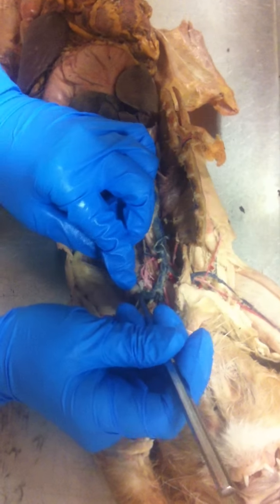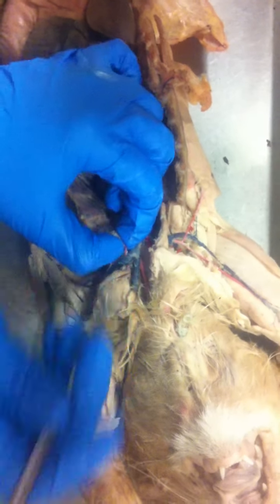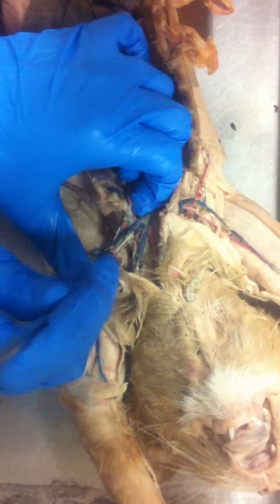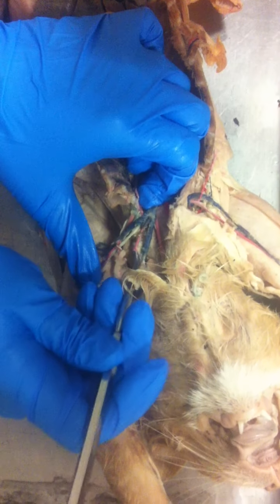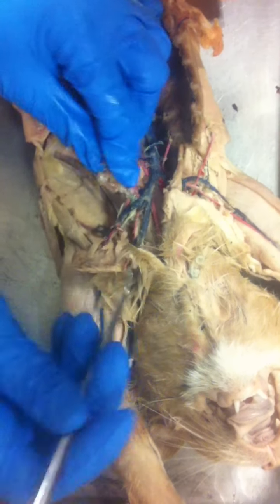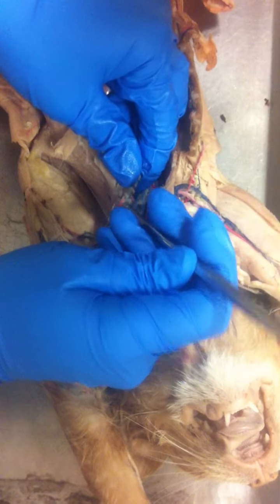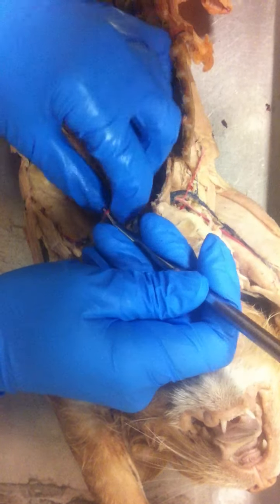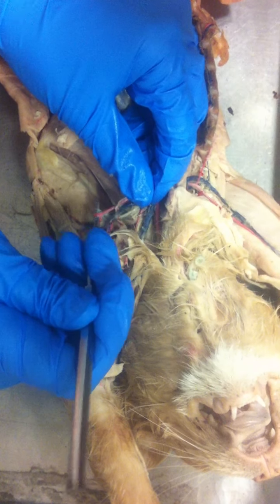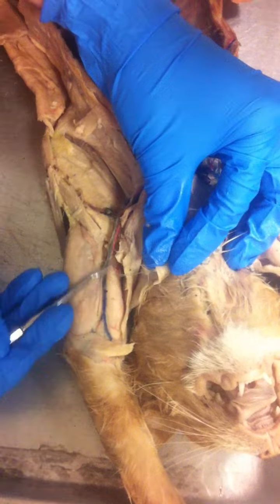That left subclavian is then going to turn into your thyrocervical artery, which continues up into the neck to go to the thyroid. And off of that thyrocervical, you have your transverse scapular, which goes down to the shoulder. The second branch is your axillary after it leaves the ribs. And then that'll continue down till you get to the subscapular artery, where it will turn into the brachial artery, which continues down into the arm.